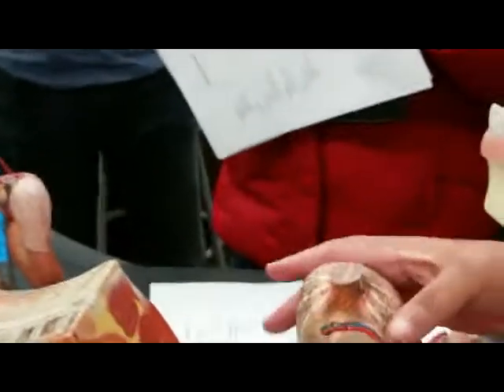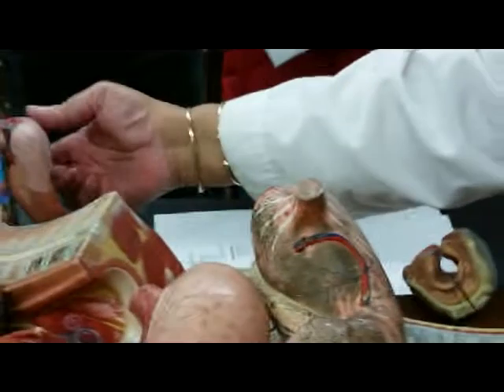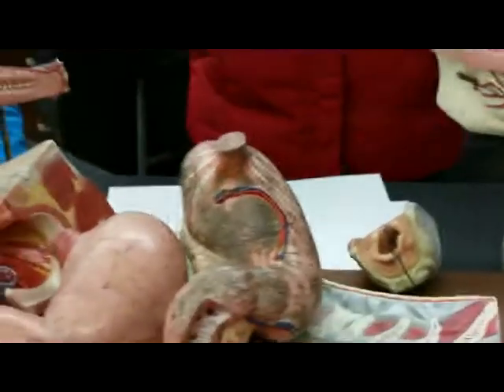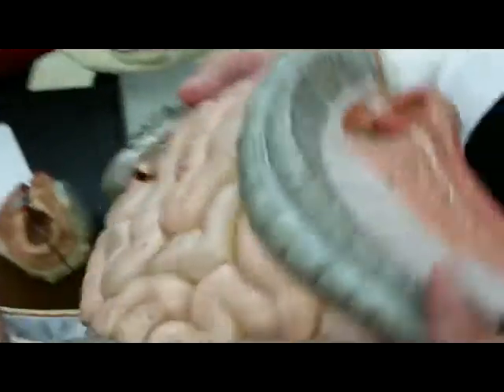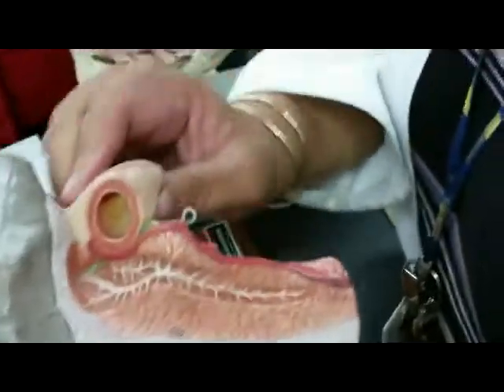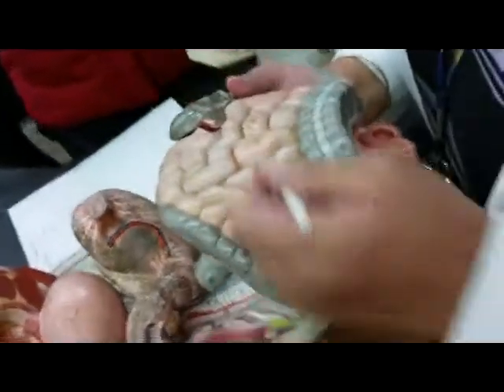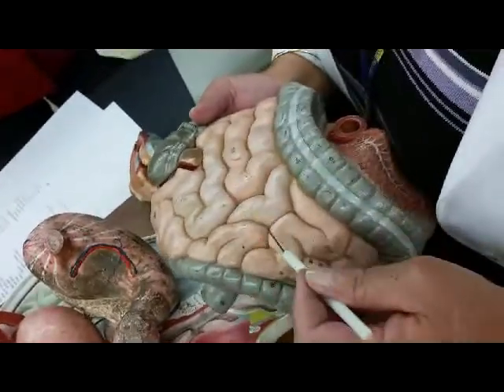And now we come to the, I've already showed you the first part of the small intestine is the duodenum. Here it is also the first part of the small intestine. And now we look for the jejunum and the ileum. And very important, head, tail, body, and the pancreatic duct. The first part of the small intestine, the duodenum. You can't really distinguish the jejunum because you don't see where it actually stops. So I'm not going to test you on the jejunum.